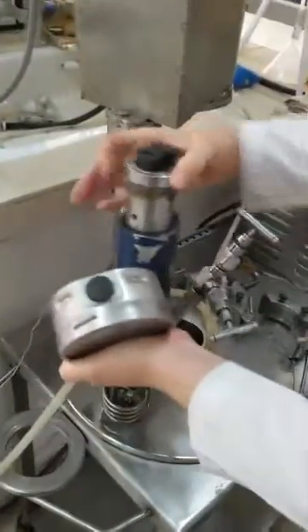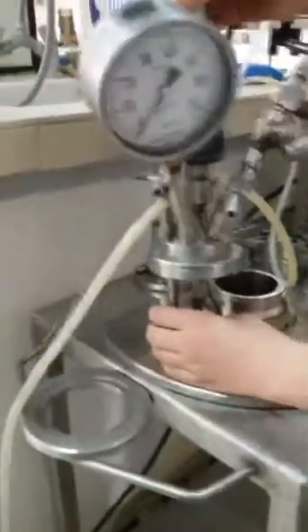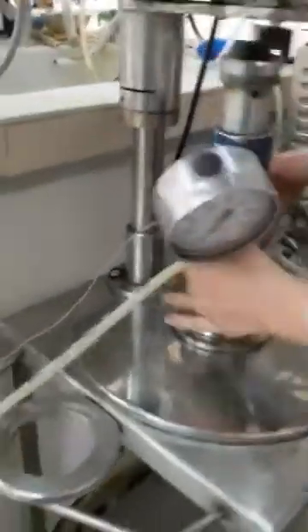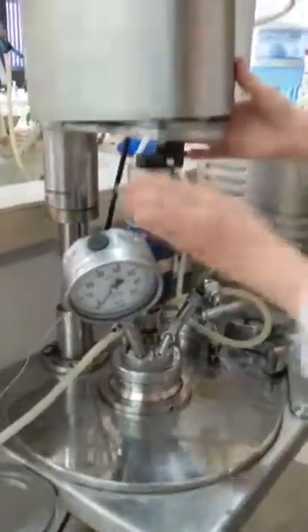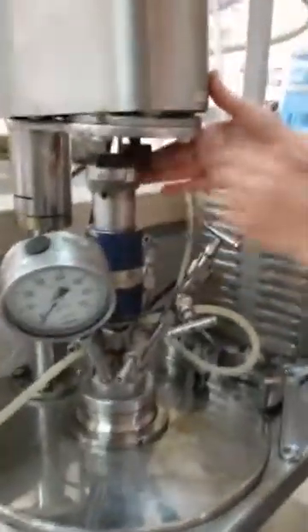I have the impeller here, which is connected directly with the motor up here. I also have the stirring wheel. I can put it inside the vessel like that, and of course it has to align with this impeller up here.